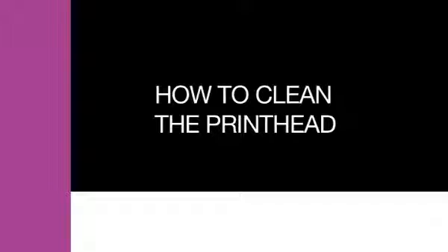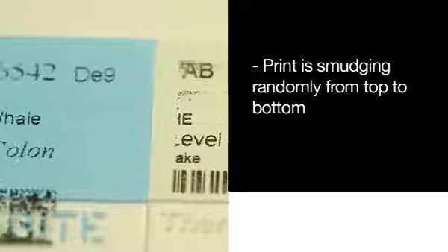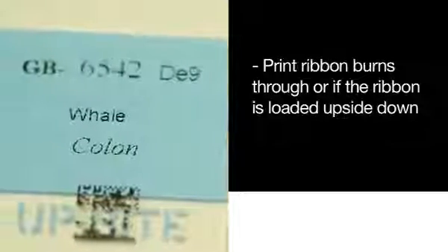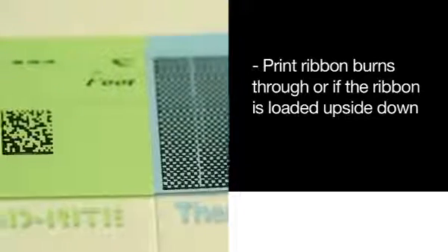How to clean the printhead. Cleaning the printhead should only be done if any of the following are true. The print is smudging randomly from top to bottom. The print ribbon burns through, or the ribbon is loaded upside down. The printhead was touched with ungloved fingers.